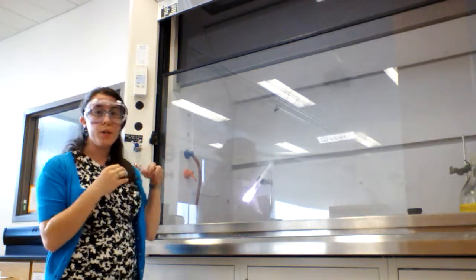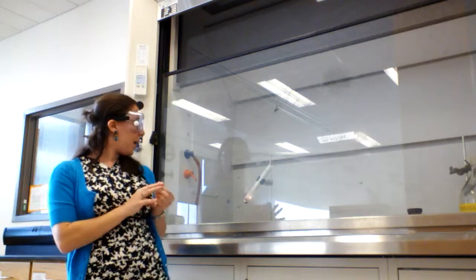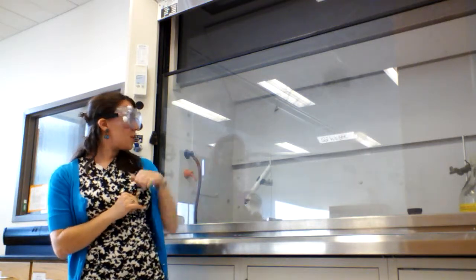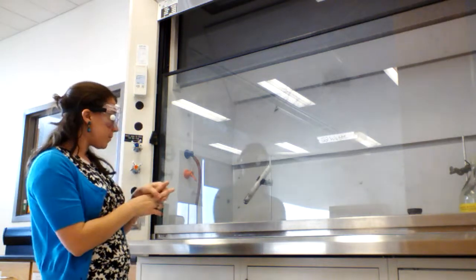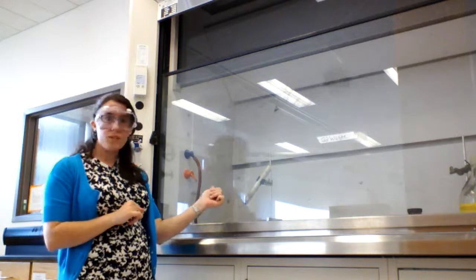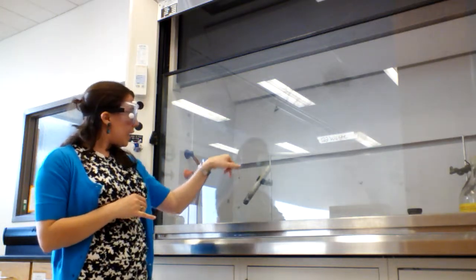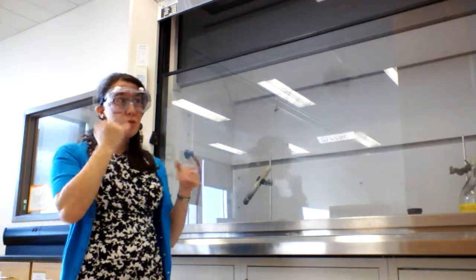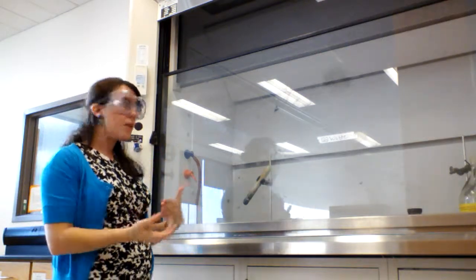We know that when we burn a carbohydrate or any other organic compound, this vapor that's coming off is going to be partly carbon dioxide and partly water vapor. At the bottom, what's left is some soot. When we burn a carbohydrate, we have some soot left. Carbon. And we saw all those bright purple flames, which probably isn't usual if you think about when you've seen like a wood fire or burning paper or something.